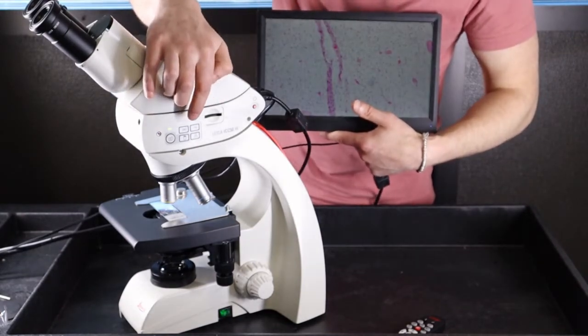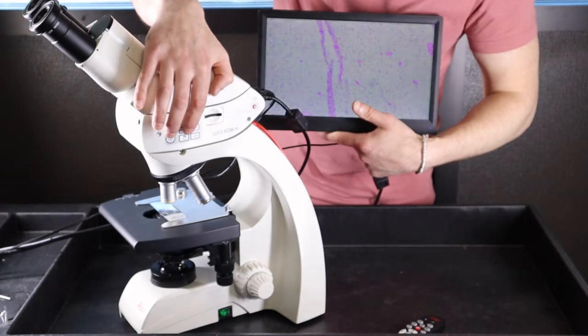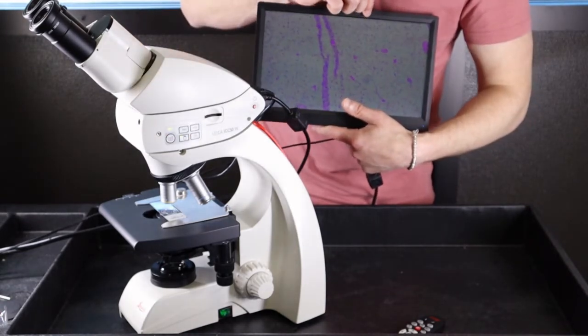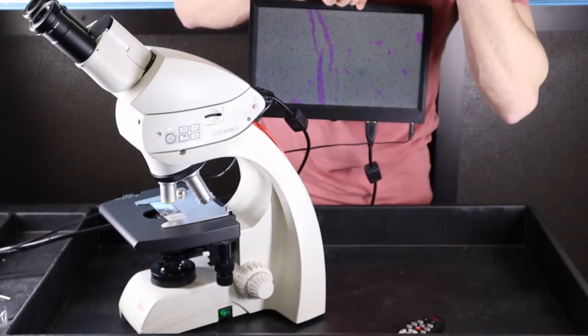Once it has initiated, the SD card symbol will become solid. That means the camera is active and ready to use in HDMI mode.